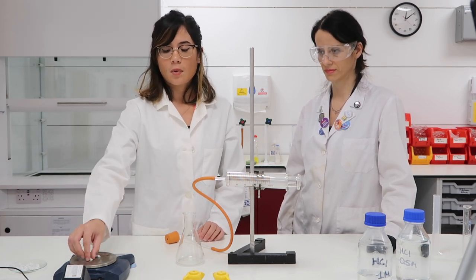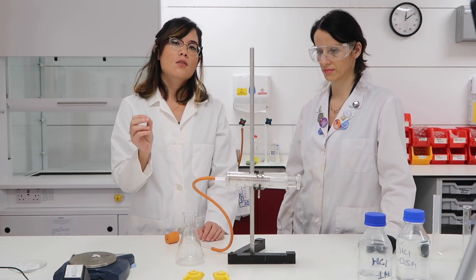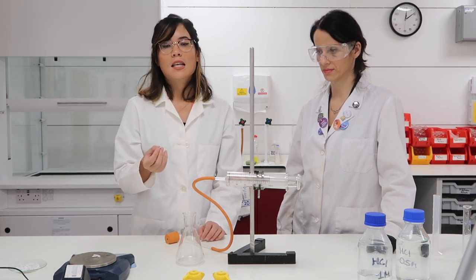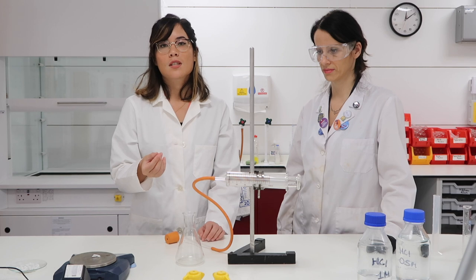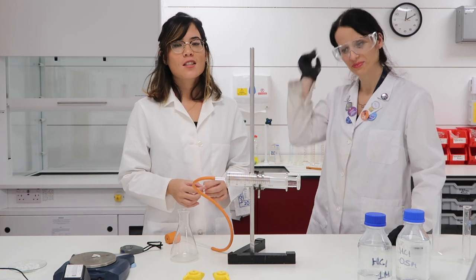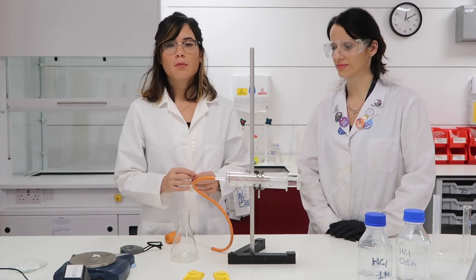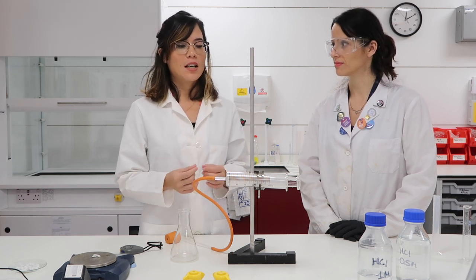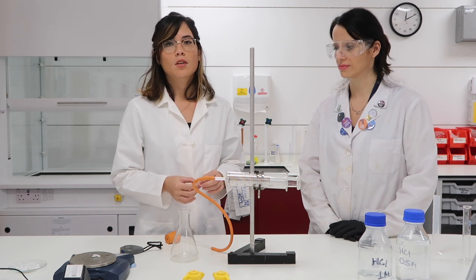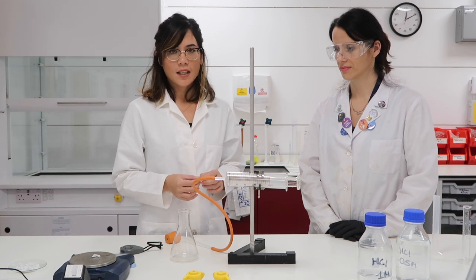It's a very simple experiment using acid and marble chips, which are calcium carbonate. To summarize the equation: hydrochloric acid plus calcium carbonate produces calcium chloride plus carbon dioxide plus water. We're going to look at the volume of carbon dioxide produced over a time period of one minute, then compare the volume of gas produced by the 1 molar versus the 0.5 molar concentration of hydrochloric acid to determine which reaction took place more quickly.